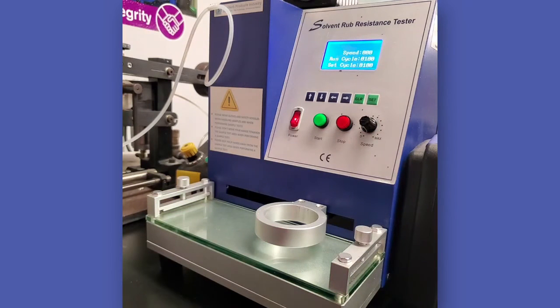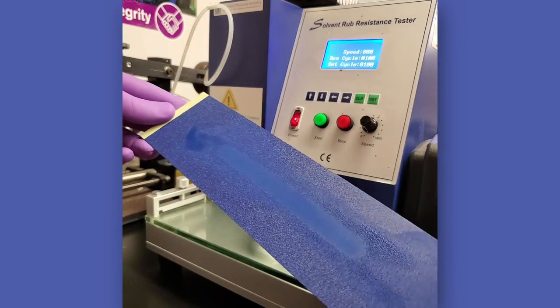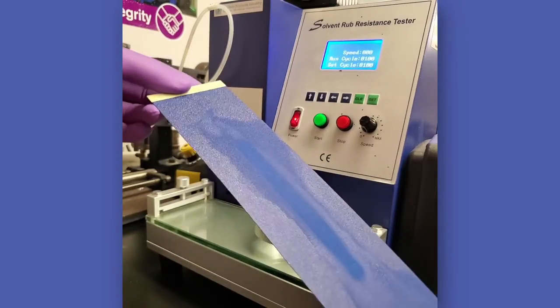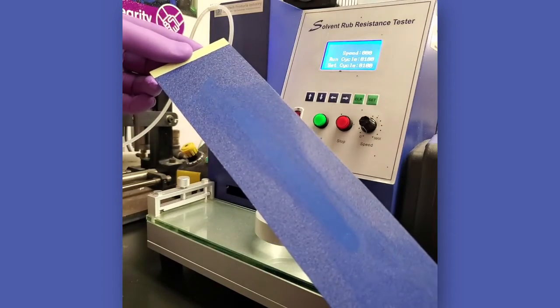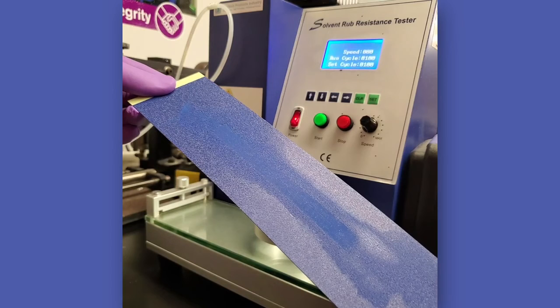In the second method, the machine is also allowed to run until the operator observes the appearance of the substrate or coating breakthrough. The number of double rubs on the machine counter is recorded. The second method may be more useful for research or cases where comparison of continuous data is desired. Under this condition, the operator should always watch the machine while running and not step away. The machine does not stop when a failure occurs. It must be manually shut off by the operator.